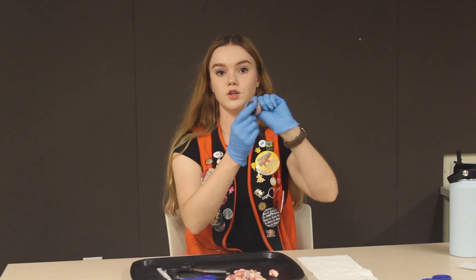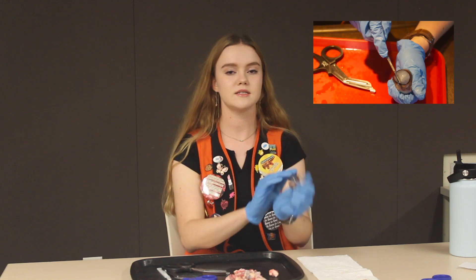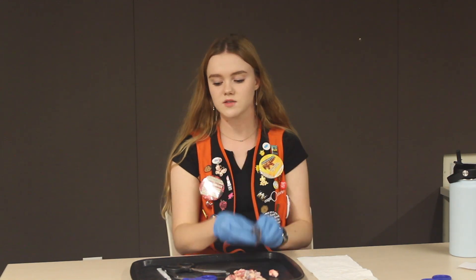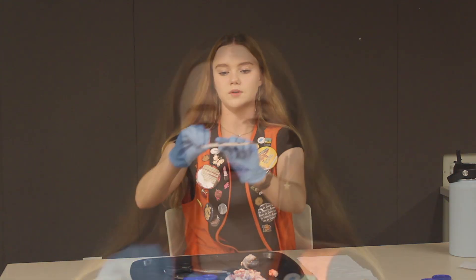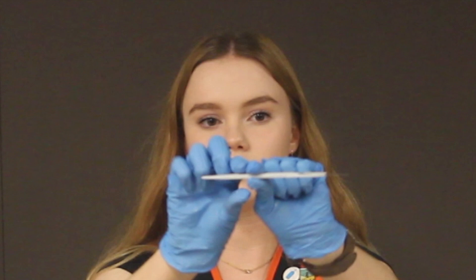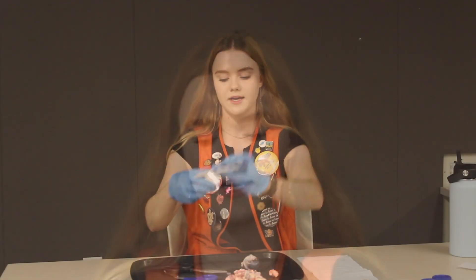This part right here in the middle is called the cornea. The cornea is super important — it does about two-thirds of all the focusing of light coming into the eye and it's really thick as well. With our scalpel you can hold it up and see that a cow's cornea is about as thick as the handle, whereas our cornea — a human's cornea — is about as thick as the blade. So you can see a visual difference right there.